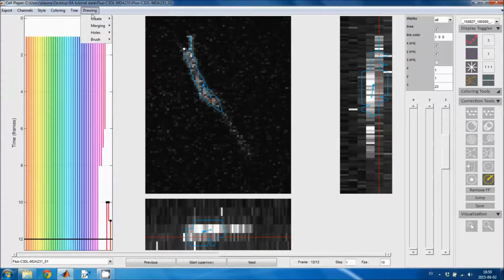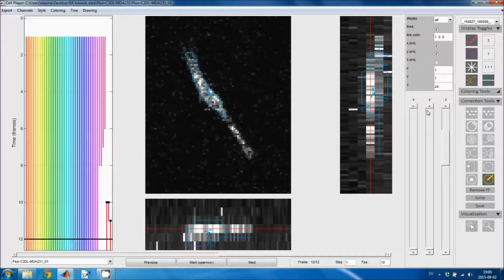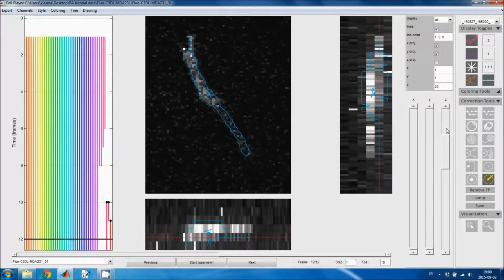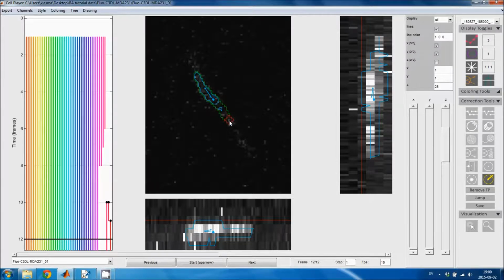The shape of the brush is a disc, so it's a circle or a circular disc in the XY view and a single pixel plane in the other two views. And I can go to the next Z-slice. Oh, sorry, I moved too far. This is the next Z-slice. And then the final Z-slice. Now I've changed the segmentation of this object.